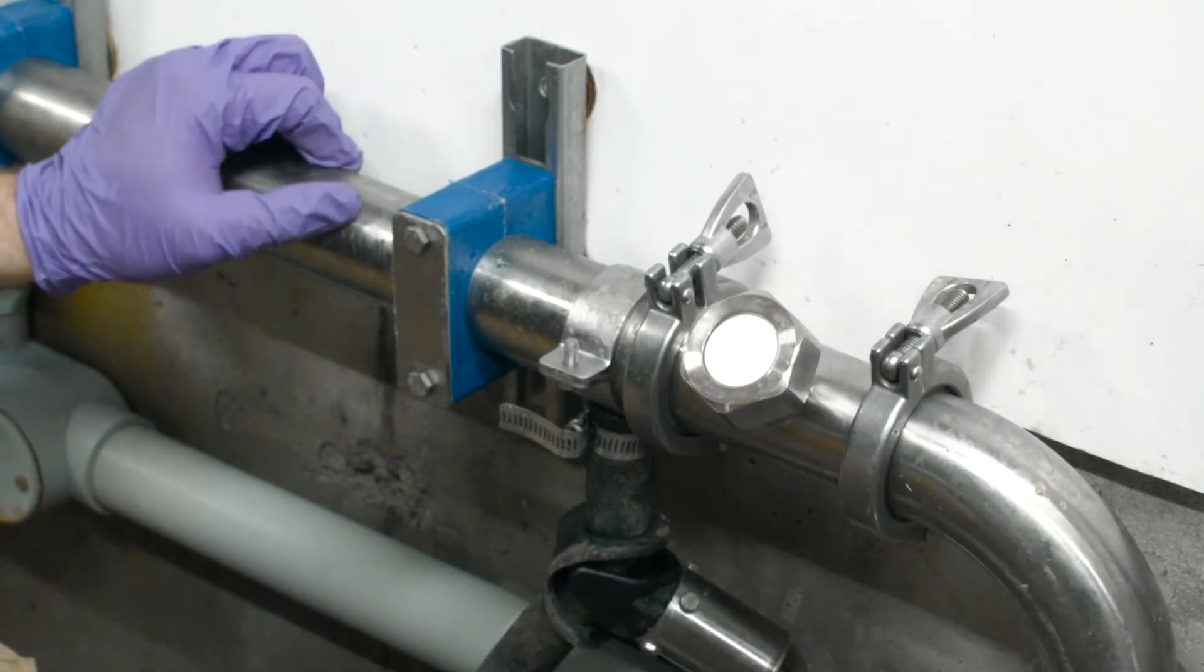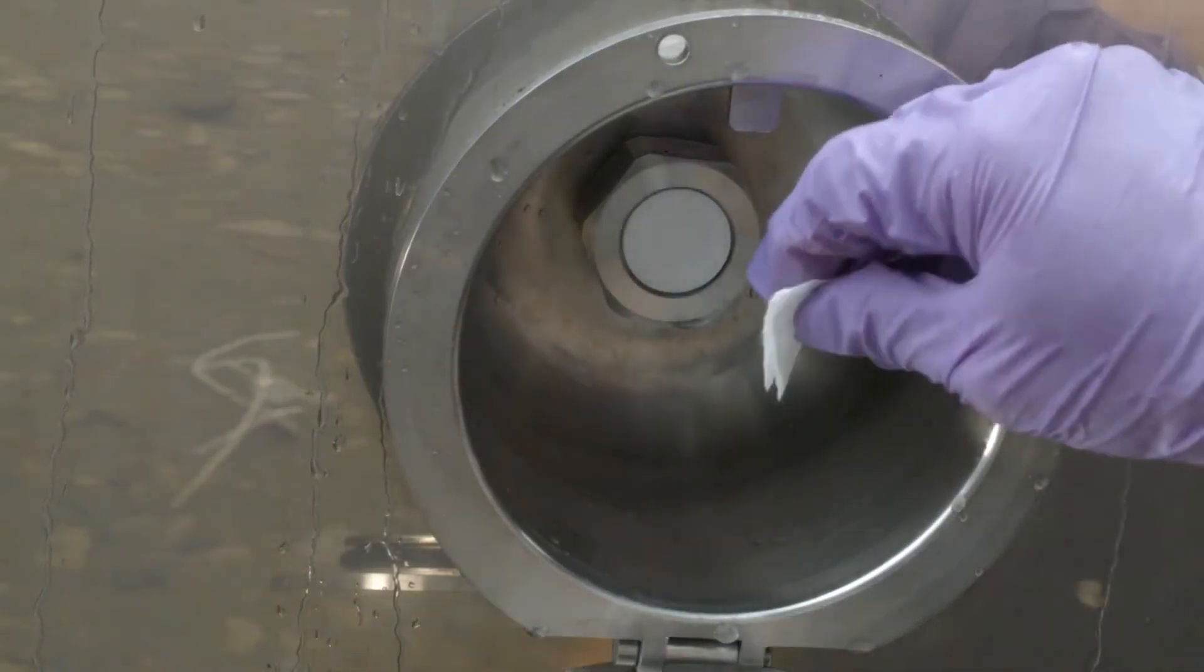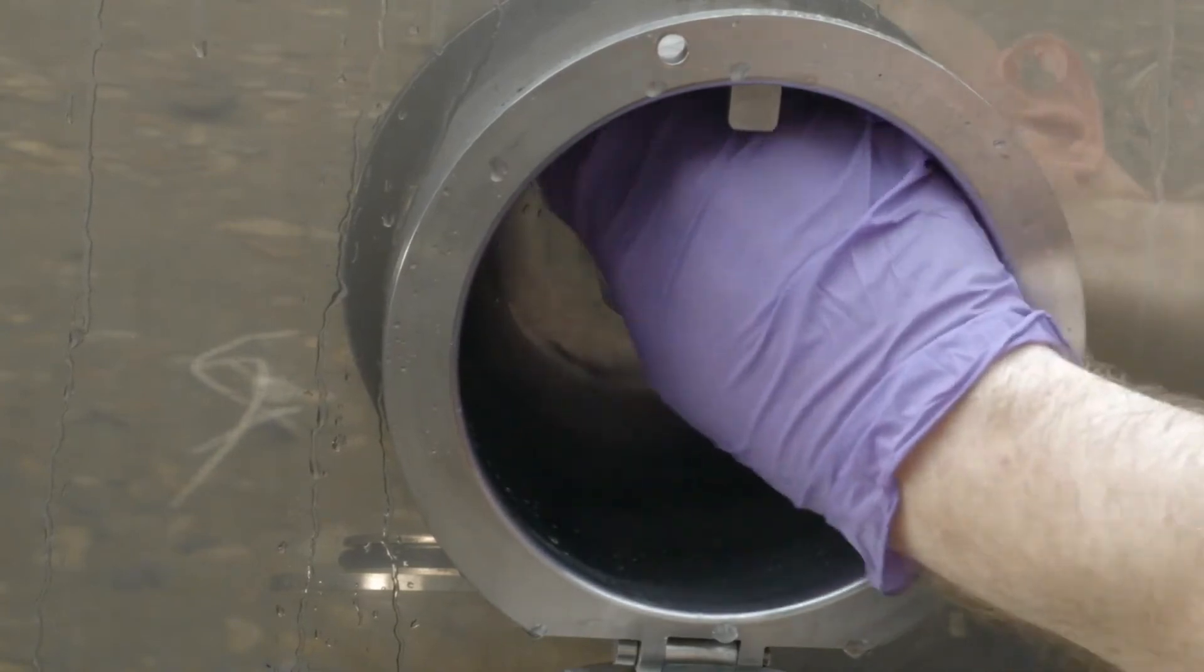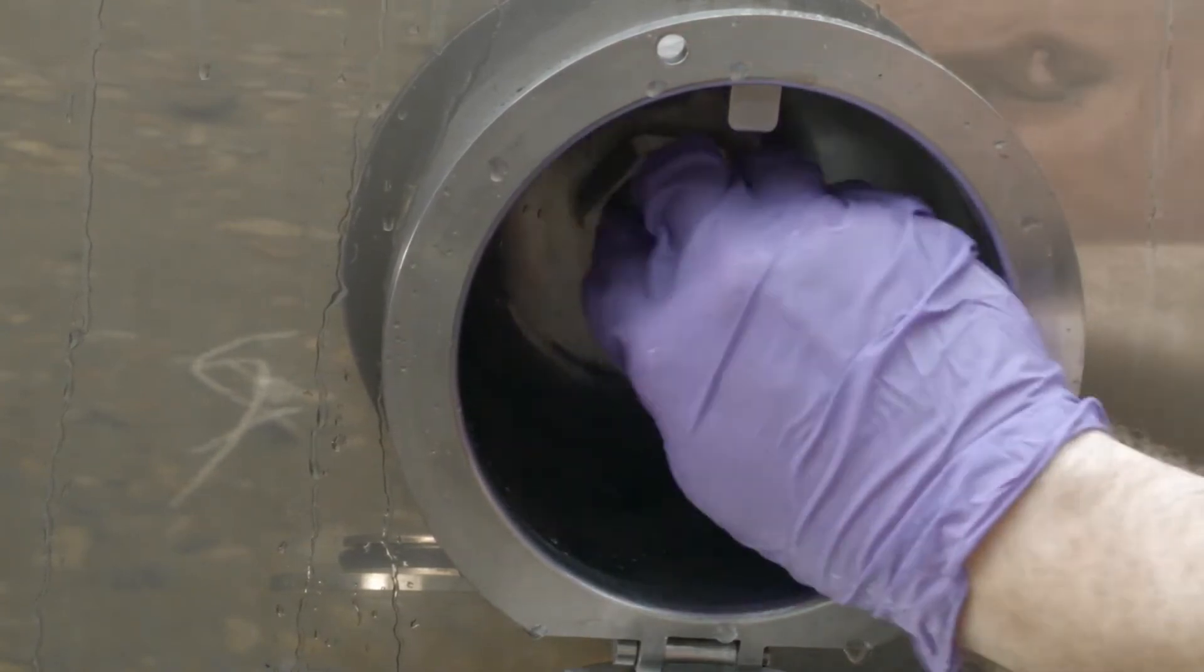Sanitize the front surface of the septum by wiping it with an alcohol prep wipe or a sanitizing solution for approximately 15 to 20 seconds.